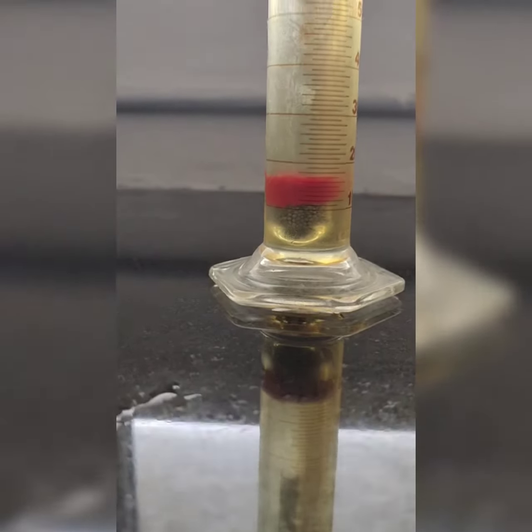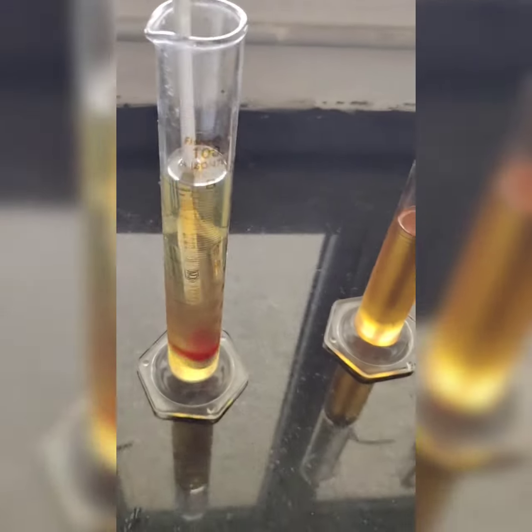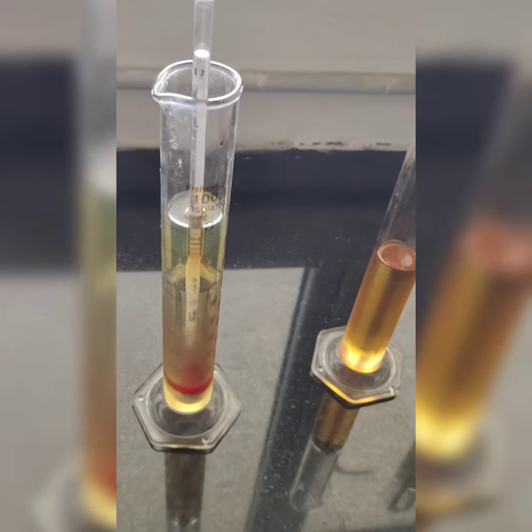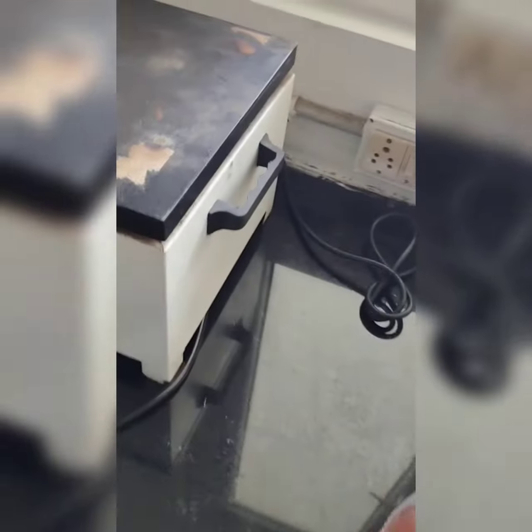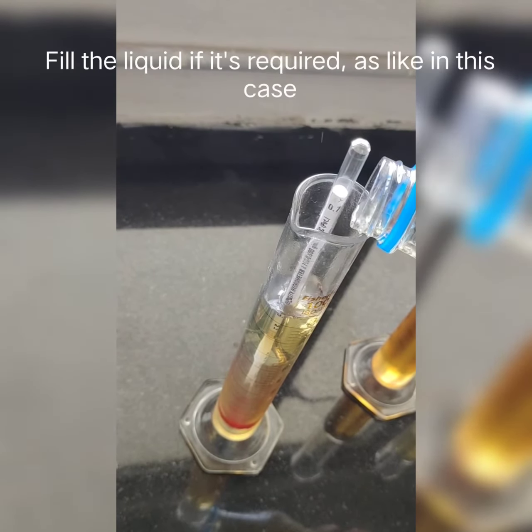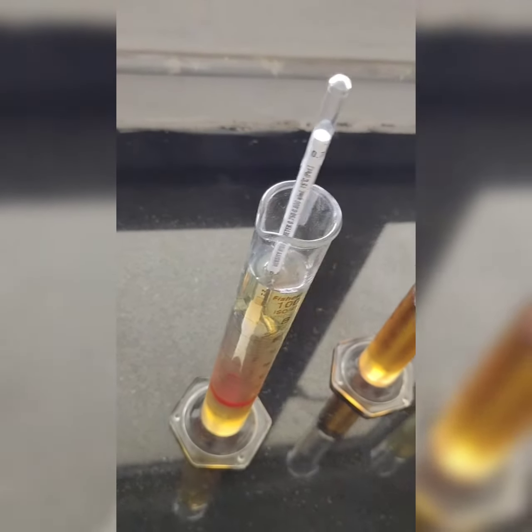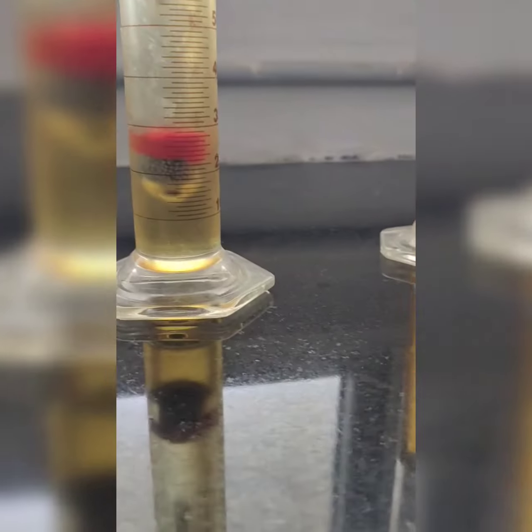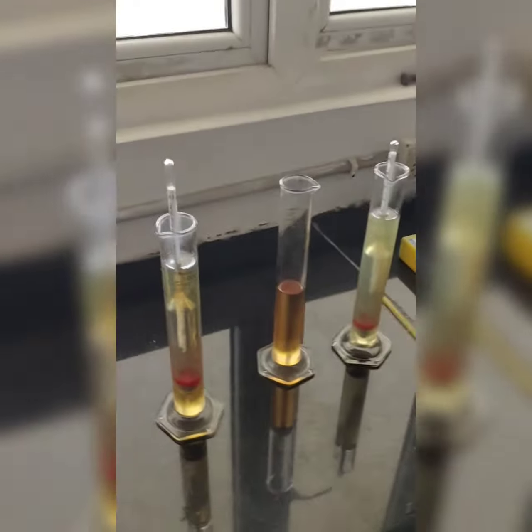A slight difference is there, but it is not touching the surface. Okay, so I have filled it. I guess I need to add some more fuel of this type, so that I can make it float to the upper side. So it has come up. The gap between the surface and it has increased.